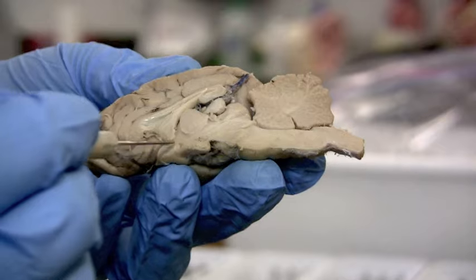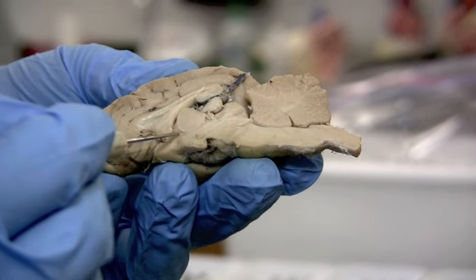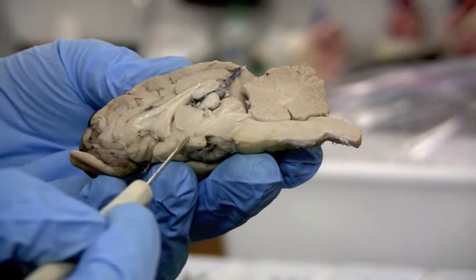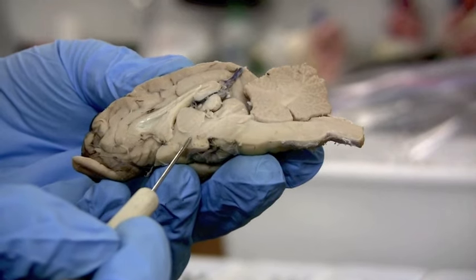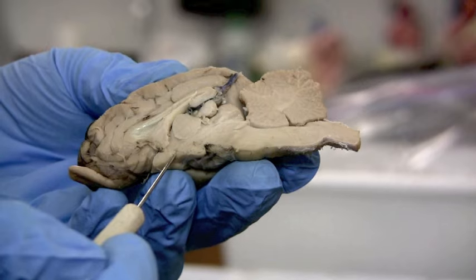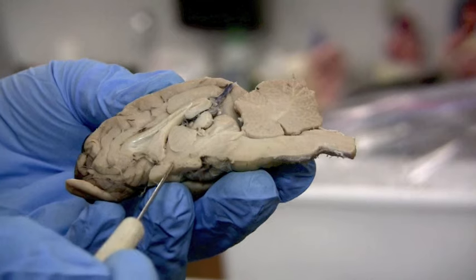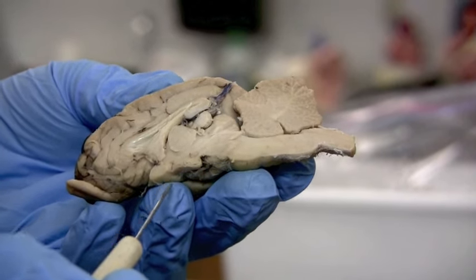This is the optic chiasm that was cut through. The hypothalamus is responsible for all sorts of functions and does produce a couple of hormones, and stimulates other hormones to be produced or distributed from the pituitary gland. This is where the infundibulum would be, and the pituitary gland would hang down from that.